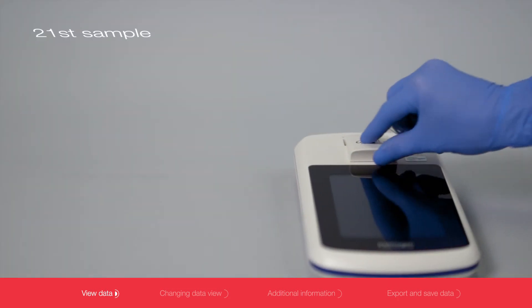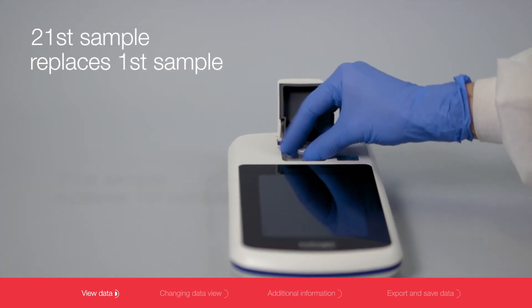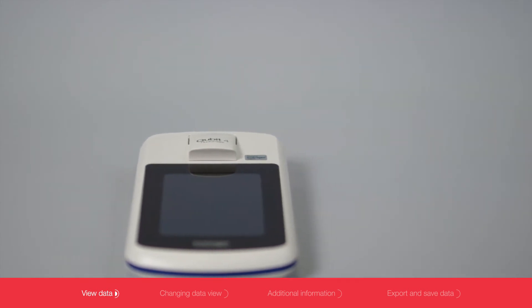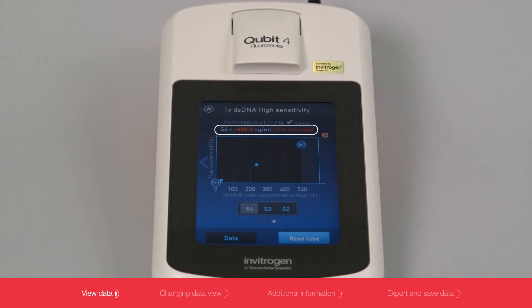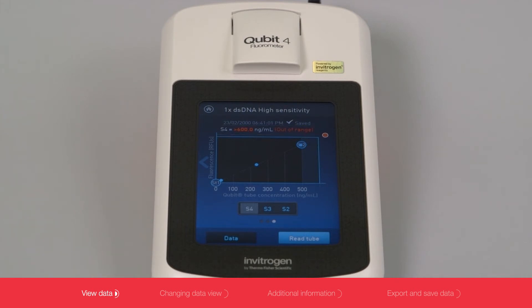If you run more than 20 samples, the 21st sample will replace the first sample. The graph will also display whether a sample is within the extended range of the assay or out of range.